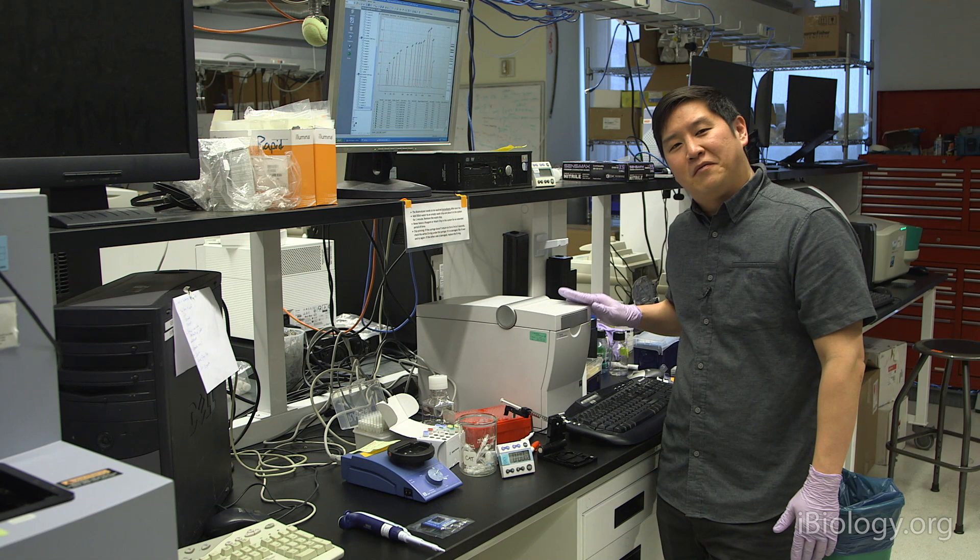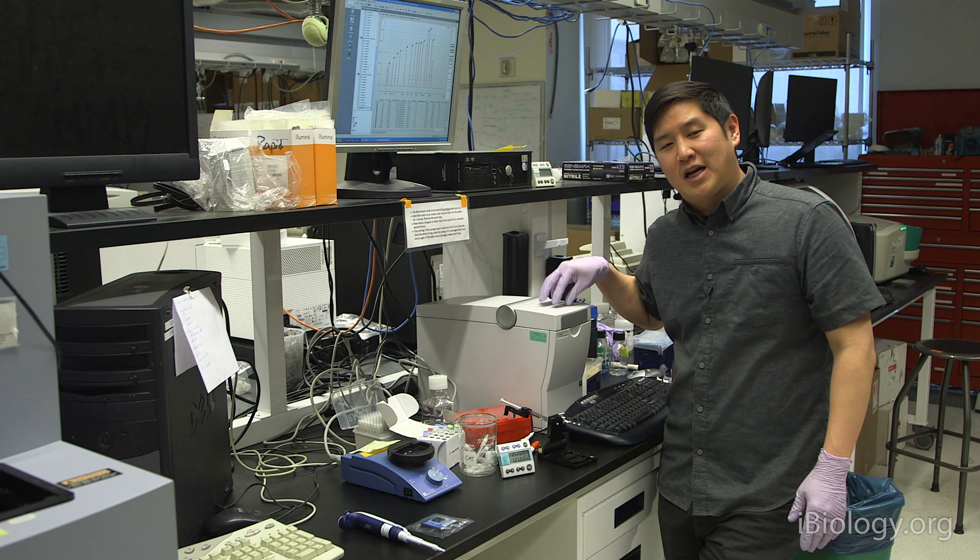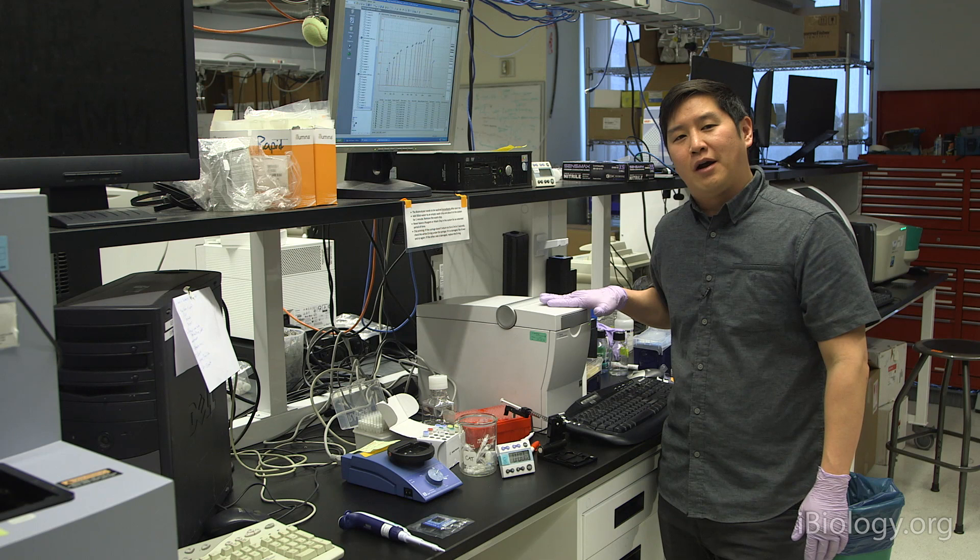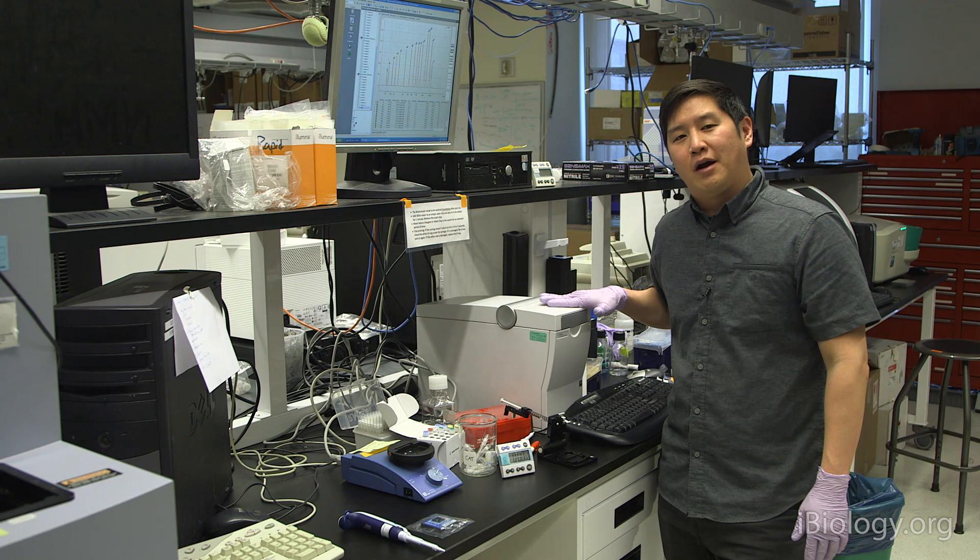The other point is that it's really important that you remove the wash chip. If you leave it in there, the water will start to evaporate and cause condensation inside of the electrode array. There are a lot of electronics up above that we don't want to get moisture on. Now that 30 seconds is up, we remove the wash chip, we can get rid of the water, set it aside, and then just close the system, and you're done.